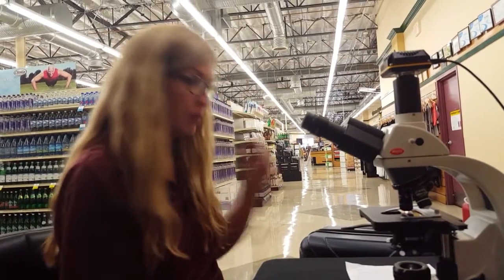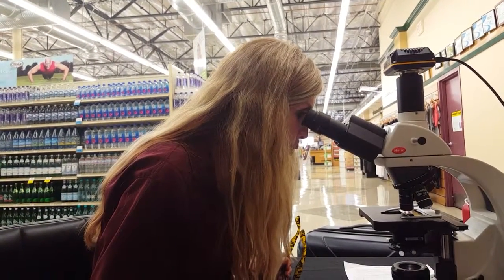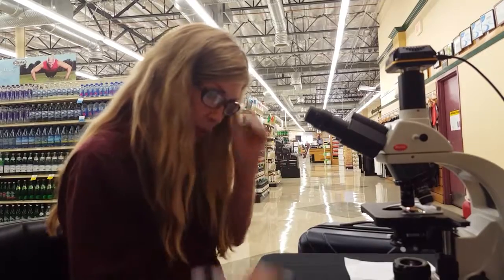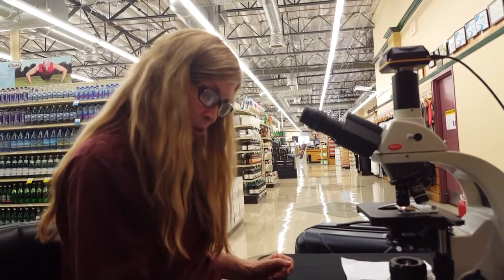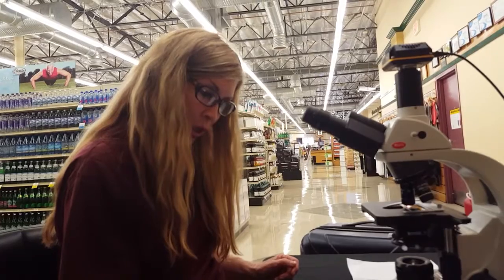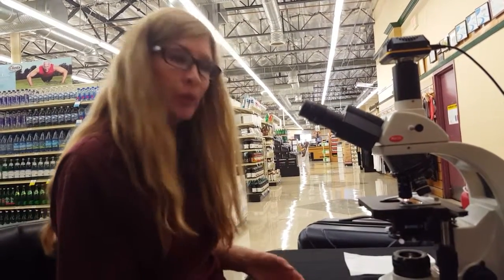Your red cells, that's a good thing, seeing how I have so much fat in my blood. Your red cells could be a little bit bigger, so your hemoglobin might be down a little bit. Might need some iron. So I'm going to recommend that too. They should be a little bit larger, so I'm going to give you a 3 on that. I don't see any fungal, so you're a 1.